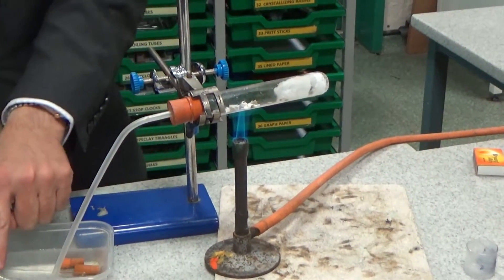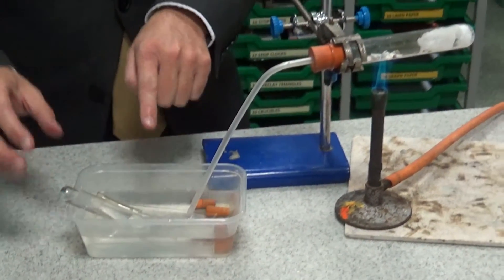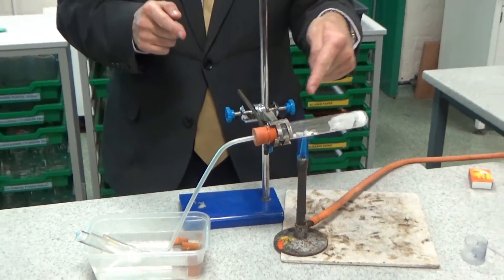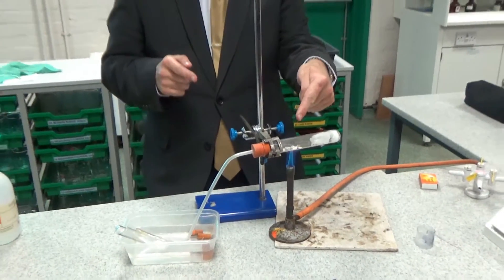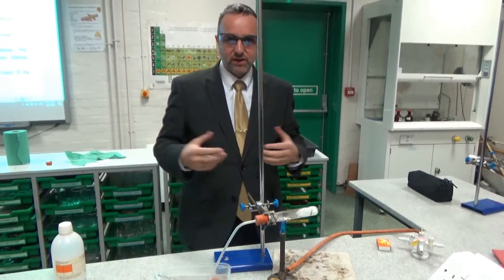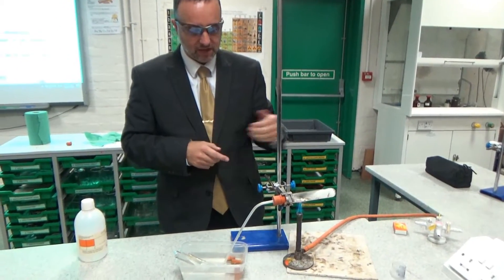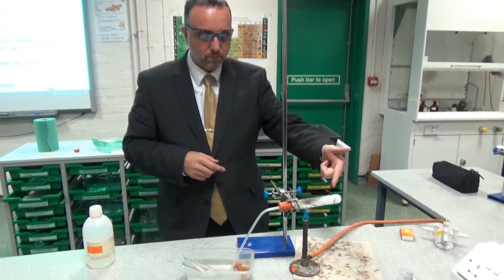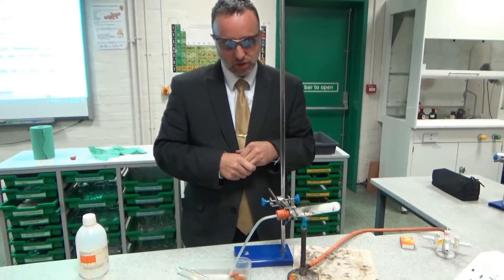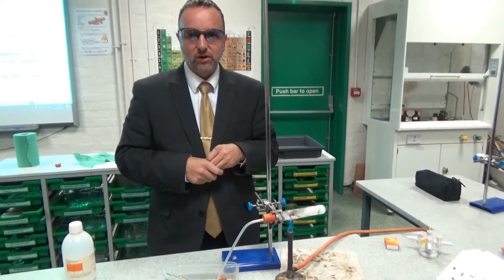So I'm going to place the Bunsen on the hot flame and place that under the catalyst and get that really hot. Now you can see straight away some bubbles came out. I don't want to collect that because that is just the expansion of air in here sending that out through there — it's not the products of the catalyst acting and cracking these molecules. So we're going to pause and let that get nice and hot.